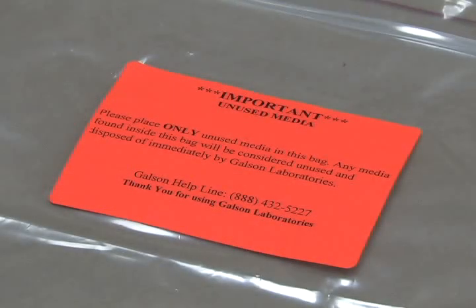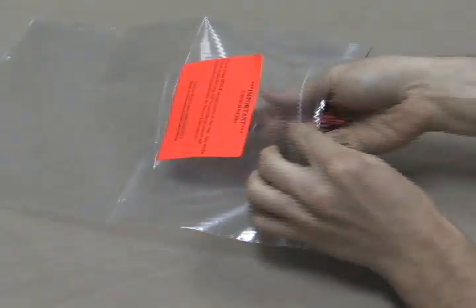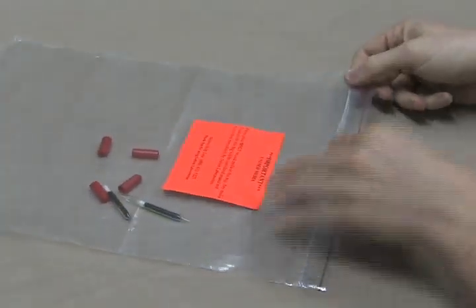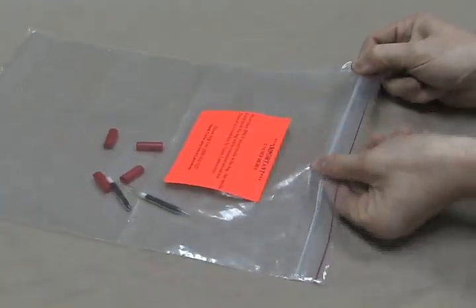Please place any unused media inside the Ziploc bag marked with the orange unused media label. This will indicate that these items should not be analyzed and will be properly disposed of by Galson Laboratories.